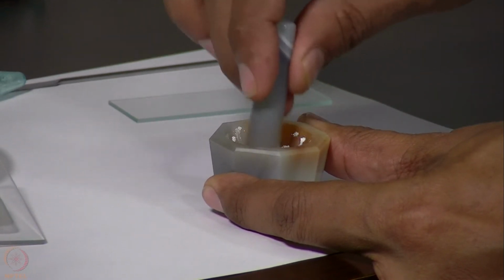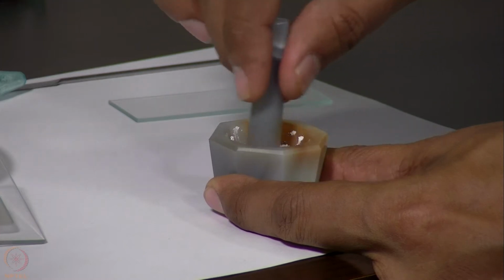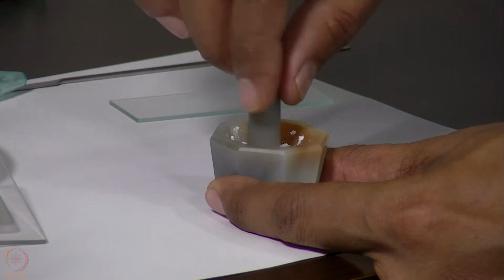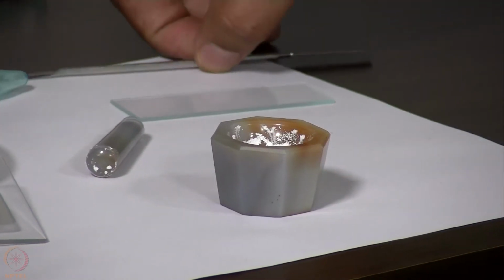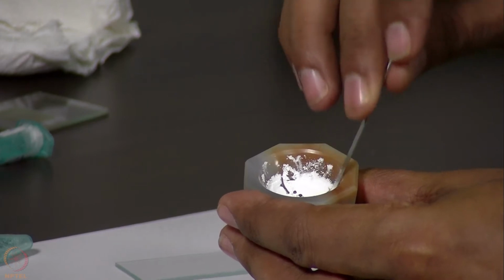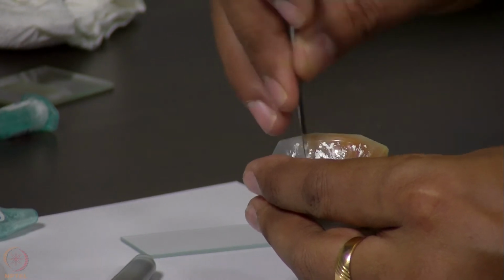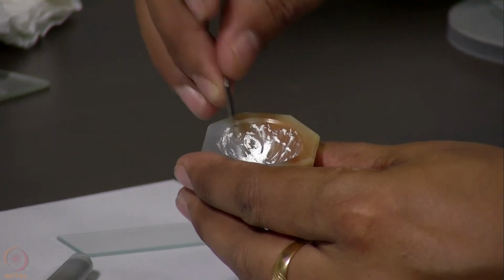This grinding should be done very carefully, and harsh grinding may lead to conversion of the sample to a different form. In case the sample contains some solvent, it may so happen that during this grinding, if we apply too much pressure, the solvent can evaporate and lead to a different crystal structure than the starting material. So we need to then scoop out this sample. You see that while I am scratching, the surface of this stone is not getting scratched.